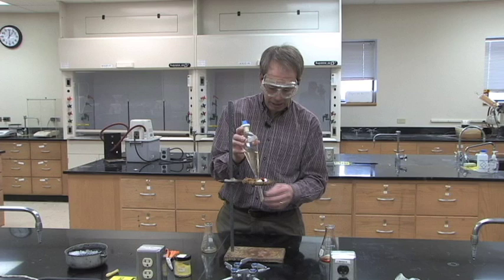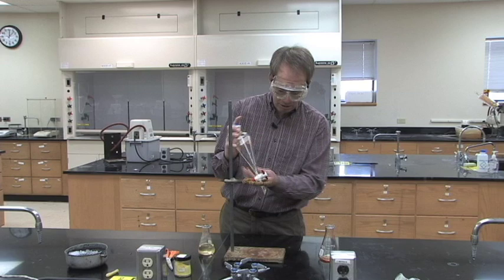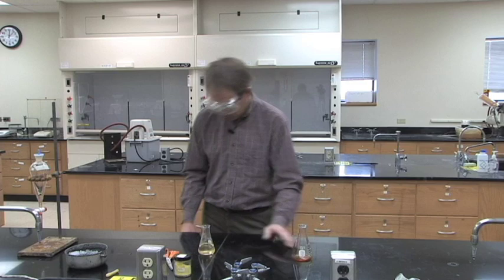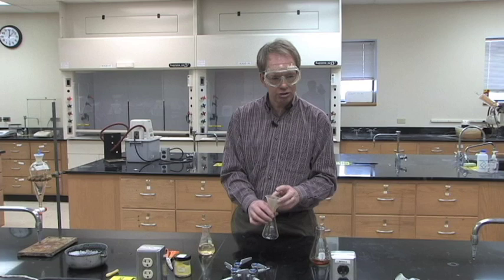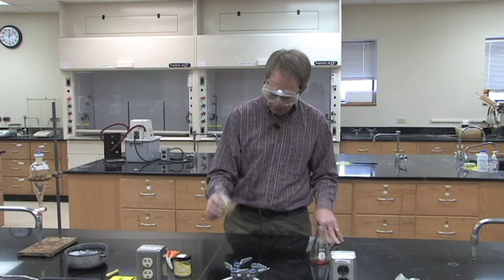In the end you'll have two flasks: one that has the methylene chloride from all the extractions, and the other is the sodium hydroxide layer. For the methylene chloride layer, add some magnesium sulfate to dry it, then flute some filter paper and filter it into a clean dry Erlenmeyer flask. Set that Erlenmeyer in your drawer and next week all the methylene chloride will be gone and you'll have nice-looking crystals.